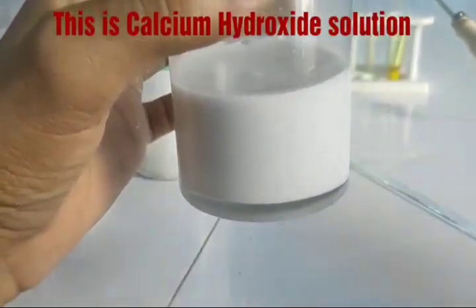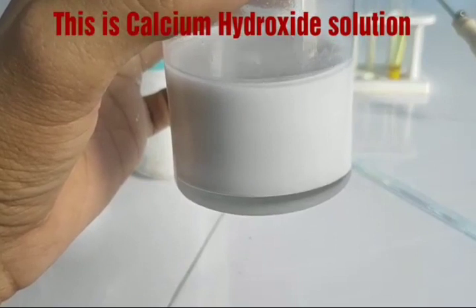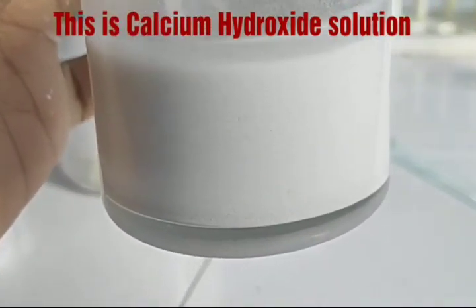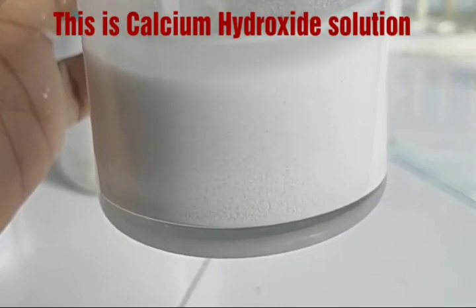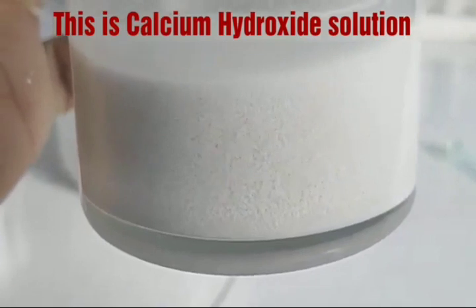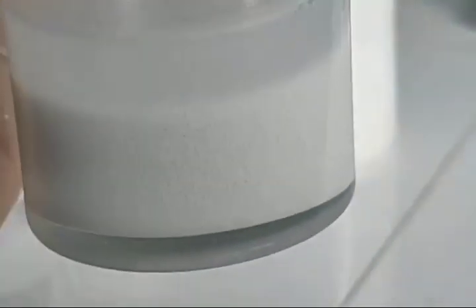This is the calcium hydroxide solution. Look here, this is calcium hydroxide, which is called slaked lime. When we touch this beaker, you can see heat energy coming out. So this is a combination reaction as well as an exothermic reaction.